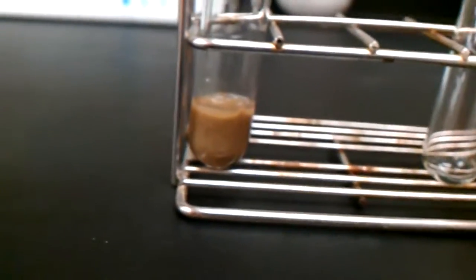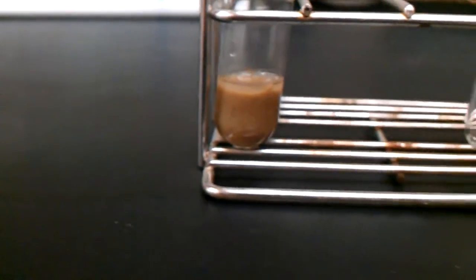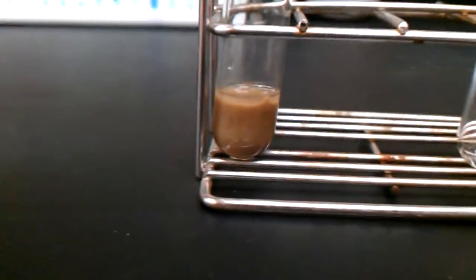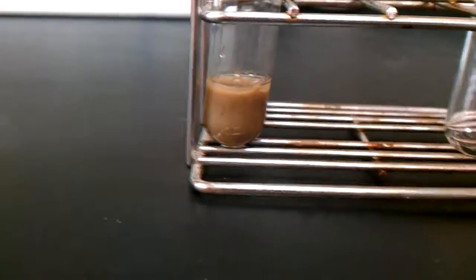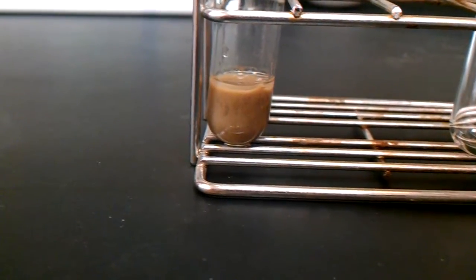This won't take too much, as the hydroxide is very high in concentration compared to the hydrochloric acid, which is 6 molar. So let's just see a little bit.